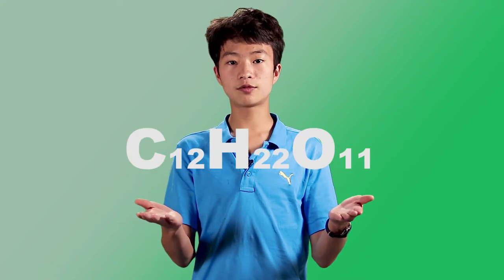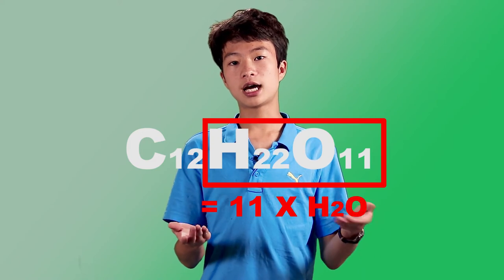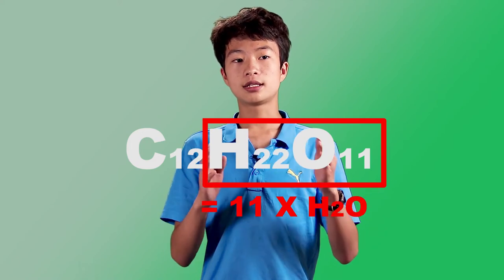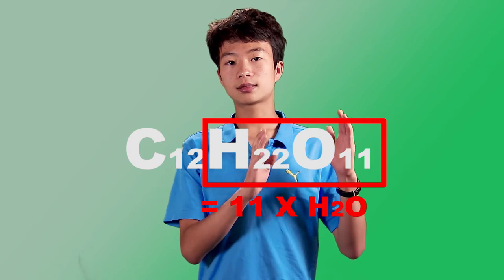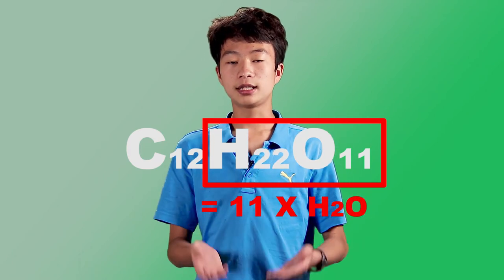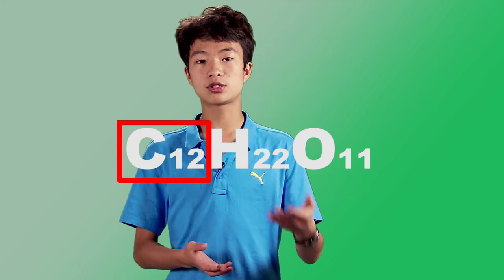You might be thinking there's no water in table sugar — and there isn't. But there is water hidden in its chemical formula. Here's the chemical formula for sucrose. As you can see, it's a one-to-two ratio between oxygen and hydrogen, which is what water is. So the sulfuric acid can rip this water away from the table sugar, leaving elemental carbon behind. And that's what you see turning black.